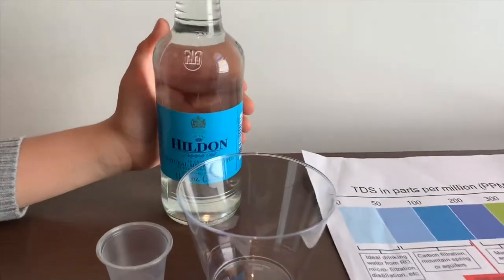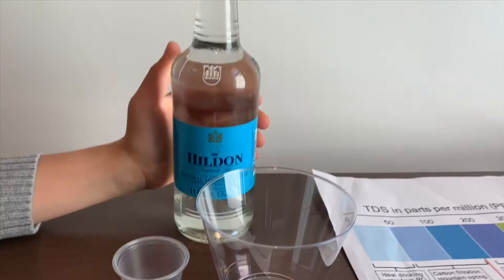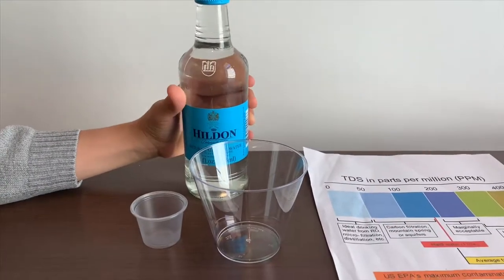It's Hildon Natural Mineral Water from England. It costs $1.99. Let's test the TDS and pH levels.